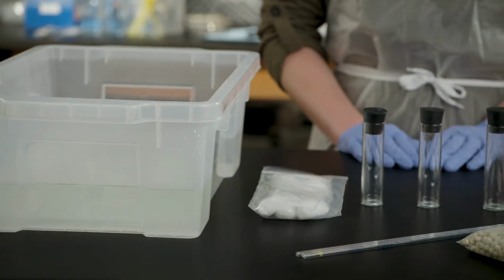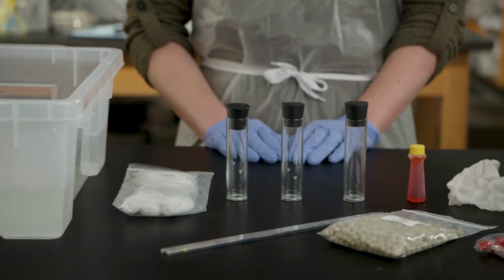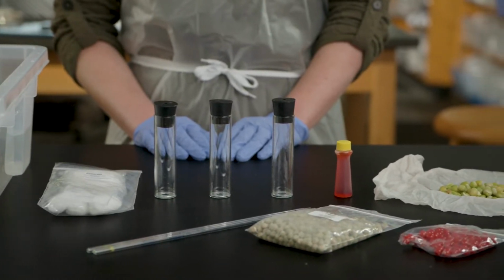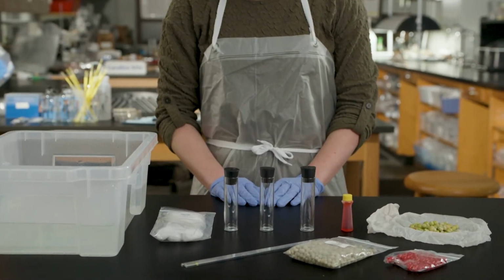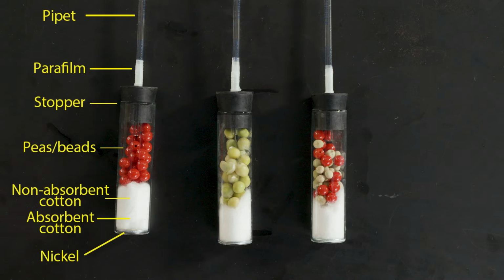This video tutorial will demonstrate the proper assembly, setup, and interpretation of the respirometers you will use in the Cellular Respiration Lab. It is important that your respirometers be assembled correctly for them to provide you with accurate data. Except for the peas and beads, each respirometer is assembled the same way.